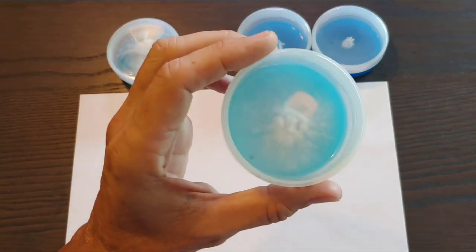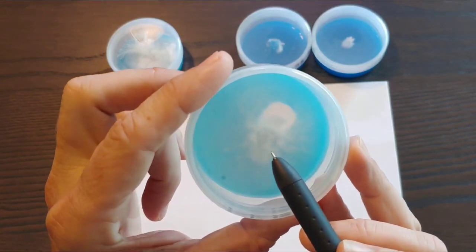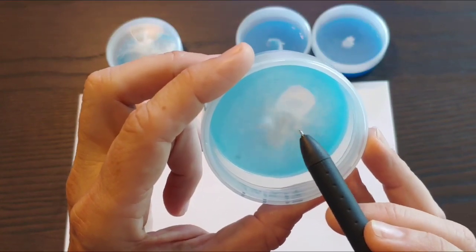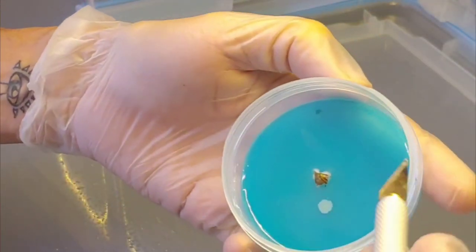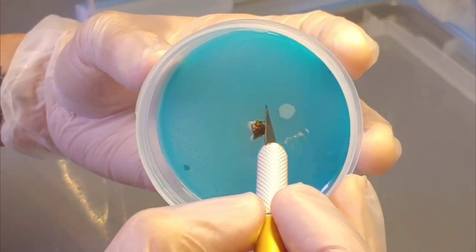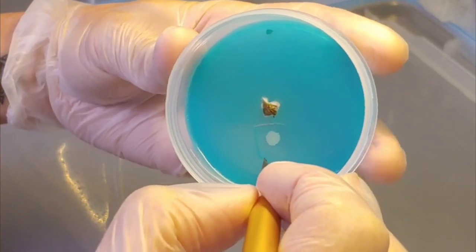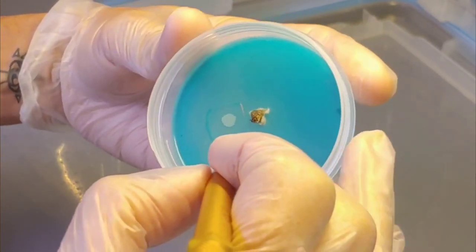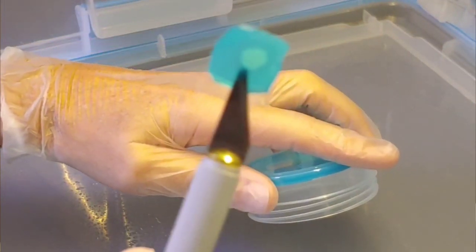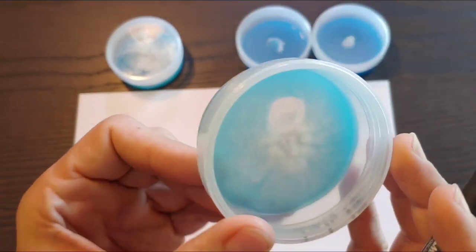All right, but what I want to go over is this. If you remember, when we put our clone tissue here, we saw, like on the second or third day, we got a big spot of bacteria or something. It looked like bacteria. So what I did was I cut around it a pretty good distance away and flicked that out quickly so I didn't touch any of this when we did that. And it kept growing fine. Perfectly fine.